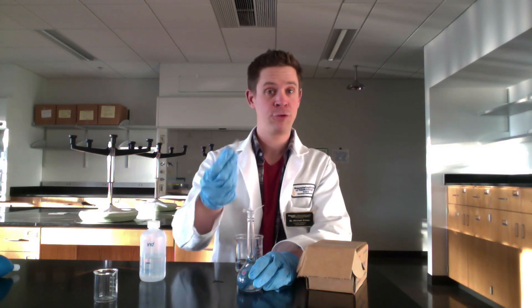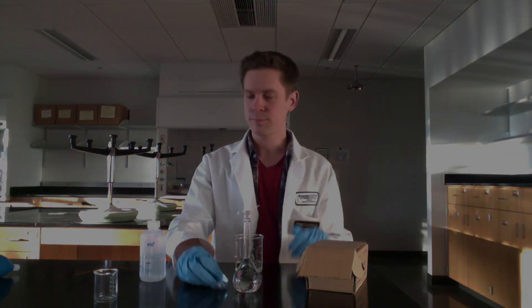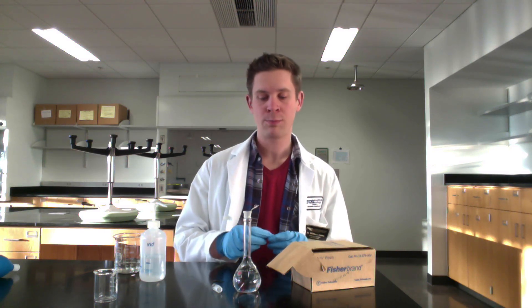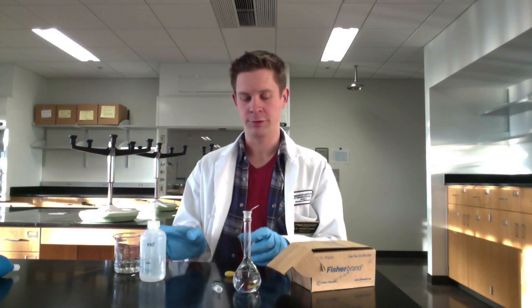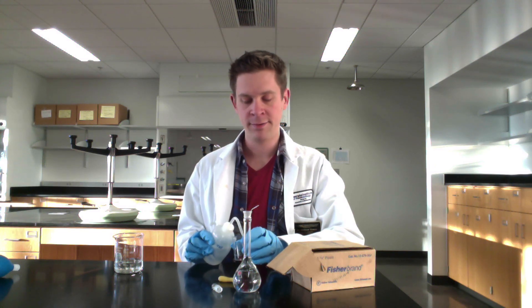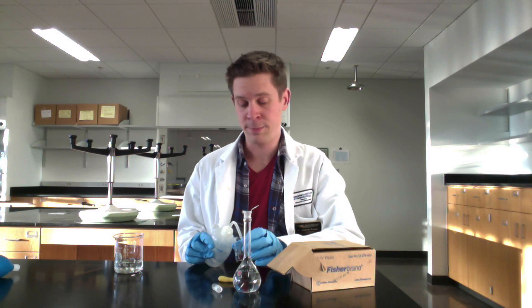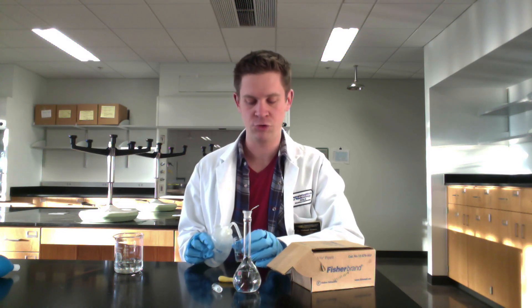Make sure to cap your volumetric flask when inverting — don't just put your thumb over the top, actually use the cap. To finish the dilution, we need to add water dropwise until we reach the liquid level, and that's what the second beaker is for. Squirt a little deionized water into that beaker so we can pipette from it. The volumetric flask is doing all the volume measuring, so the pipette doesn't need to be anything fancy or have graduations.